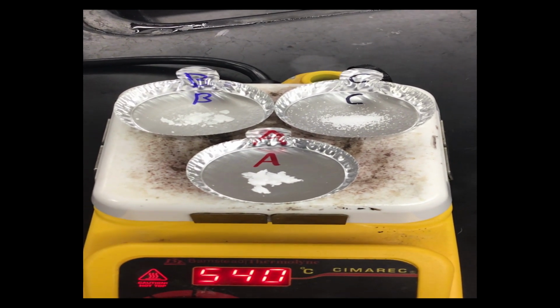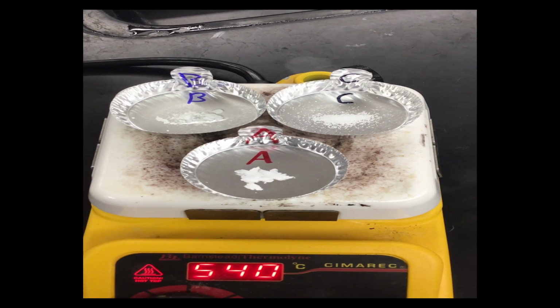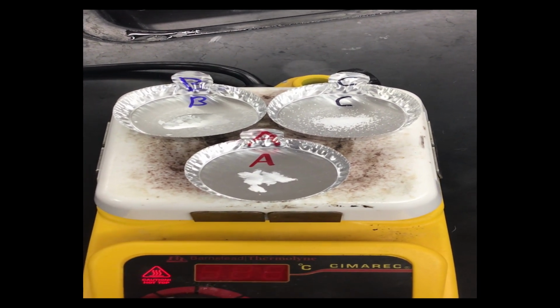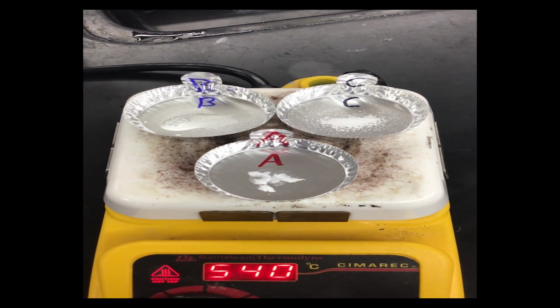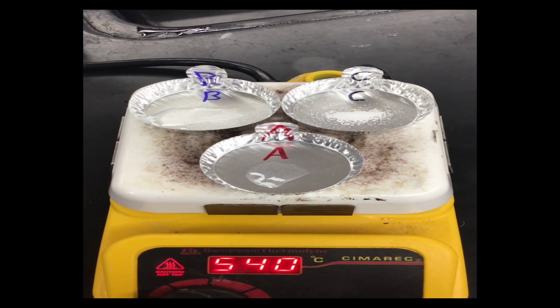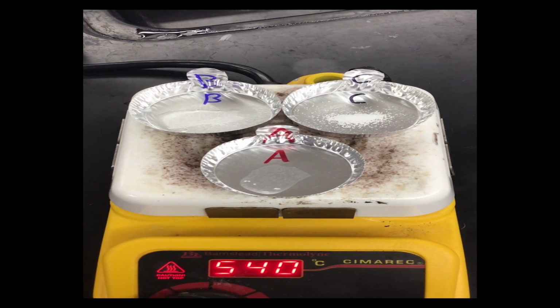So kind of pay attention here. So I am noticing already, if you took a look in the upper left-hand corner there, that B is already melting. So it looks like B is the one that melts first in our world. And then it looks to me, if you look right down, that A is now starting to melt also. So we see A is melting away fairly quickly also. And yep, A is now melted.